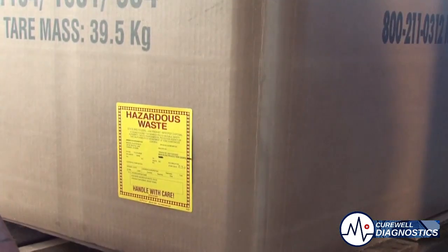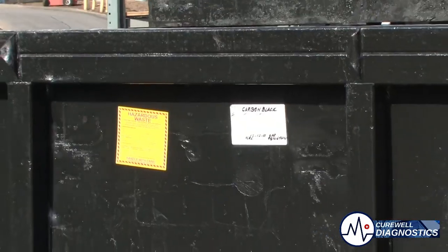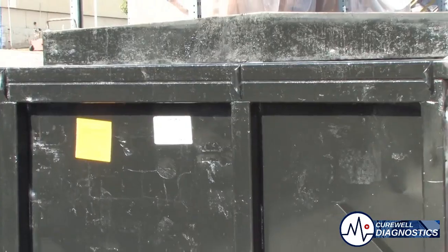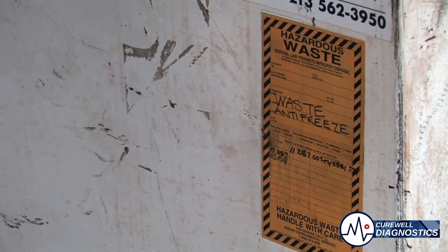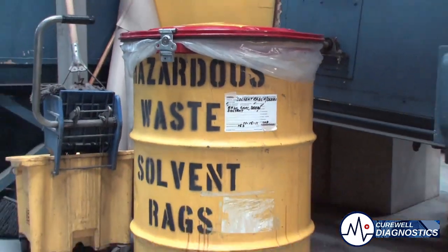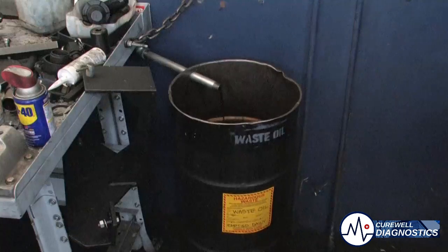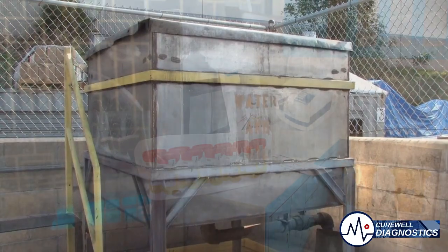Laboratory waste disposal is important to ensure the safety of the medical technologist, the public health, and the environment. In this section, we have two primary types of waste: the chemical waste and the infectious waste. This ensures that every hazardous and chemical waste we have is properly disposed of and regularly sanitized to prevent contamination.